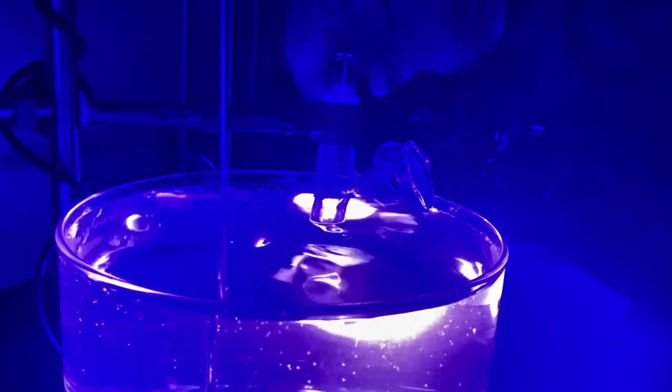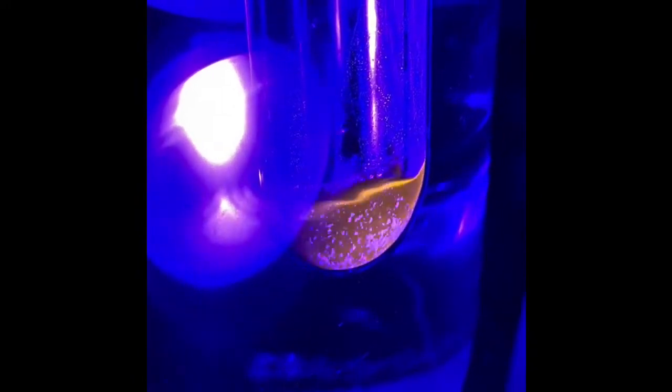After all the ingredients are added, the reaction flask is lowered into a temperature-controlled water bath that helps the reaction to stay cool in front of the hot and intense blue light source. This methodology allows us to form amide bonds under very mild conditions, and this is important because amides are present in many of the most commonly prescribed drugs.